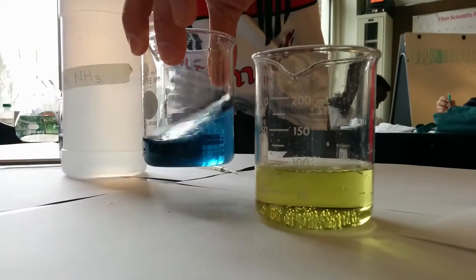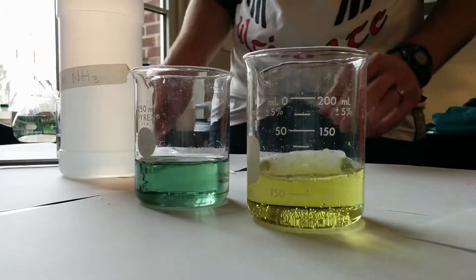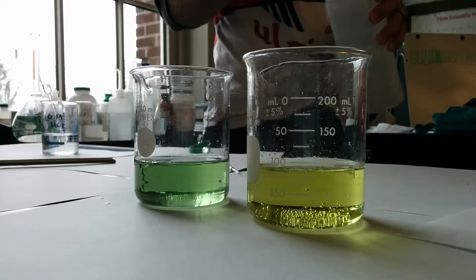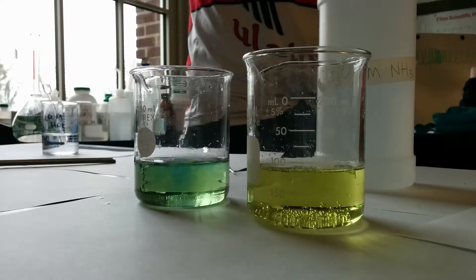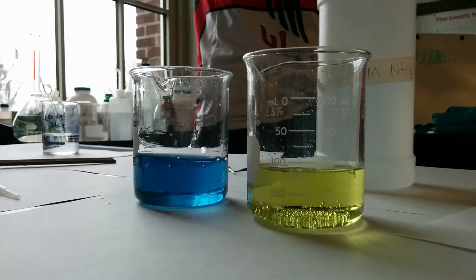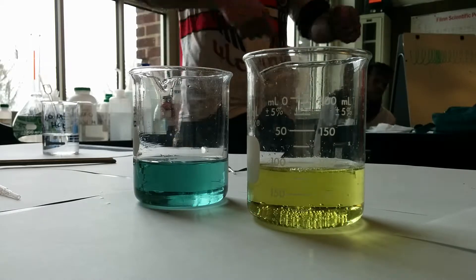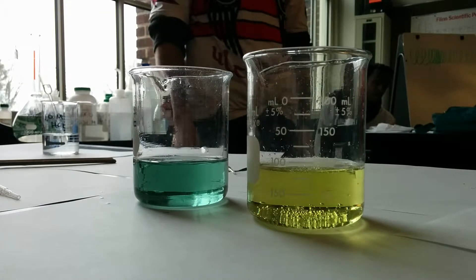It's still kind of green. This is the citric acid in the Alka-Seltzer reacting with the ammonium hydroxide — and remember, this is twice as concentrated as the HCl from last time. So it took about 30 drops to turn it. Now we'll add the HCl — and now it's back to green! Check that out — it turned back green. This is a pretty strong buffer. Sodium bicarbonate is also known as baking soda in the real world.